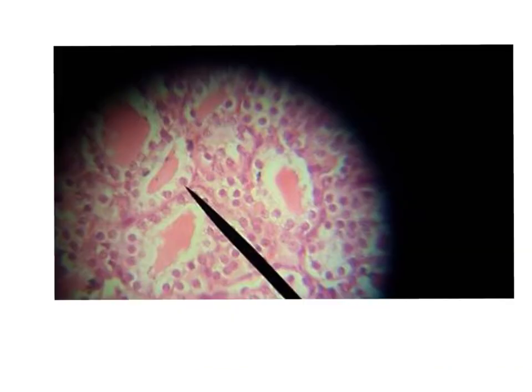The second type of the epithelium here is the simple cubical epithelium. If you see here, these are the cells at the tip of the arrow. These cells are known by the shape of their nuclei. The nuclei here are rounded. And as we see here, this is the simple cubical epithelium. I can know it by the fact that the cells here are cubical and the nucleus is central and rounded.